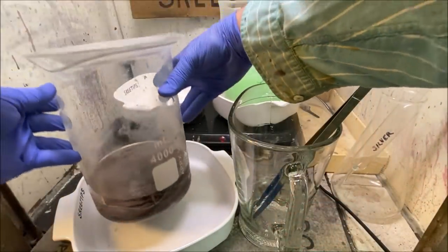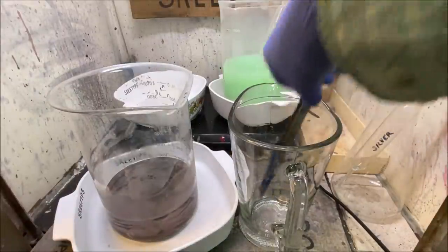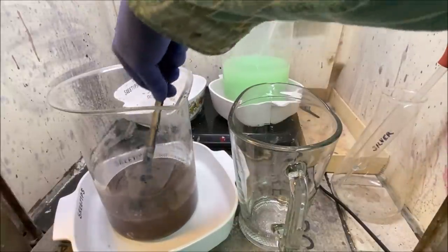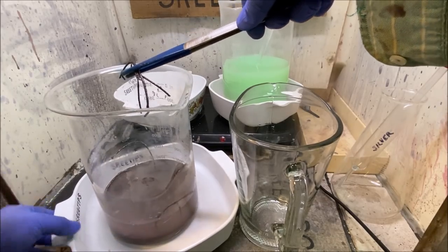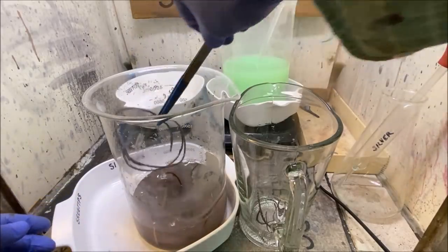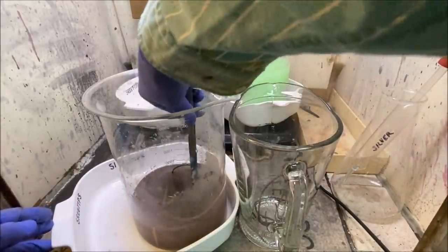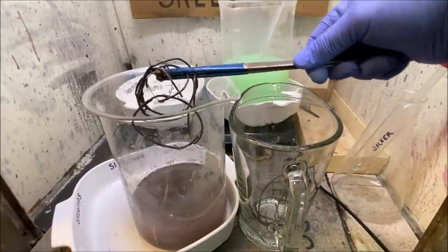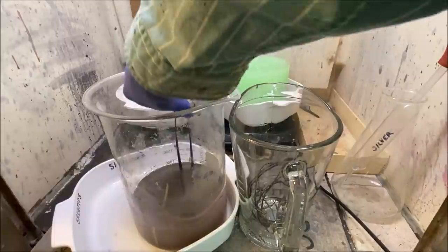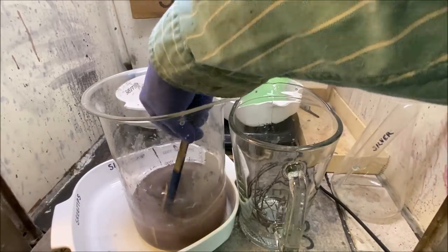I've had this on boiling another 10 hours or so and I'm committing defeat — I could not get all of this wire to dissolve. I'm going to just pick it out and transfer it into a temporary container. It should just be copper. I want to get it out of the material at the bottom of the beaker. The solution should have silver in it. The pieces of wire did start to dissolve — I probably could have kept going, but I just don't have enough time.